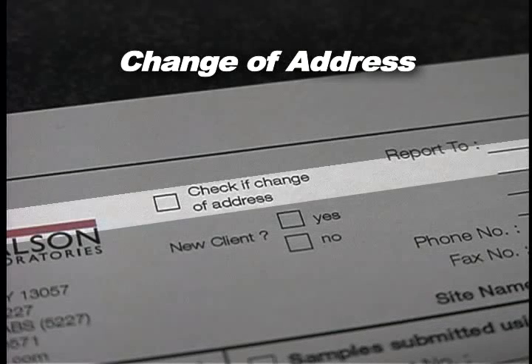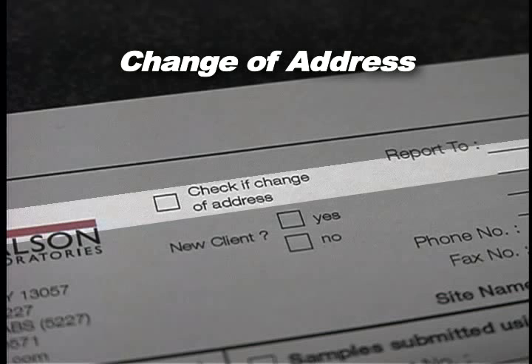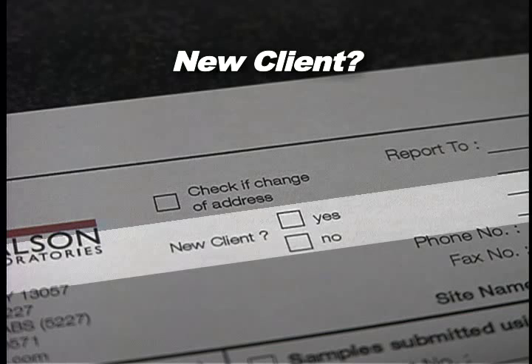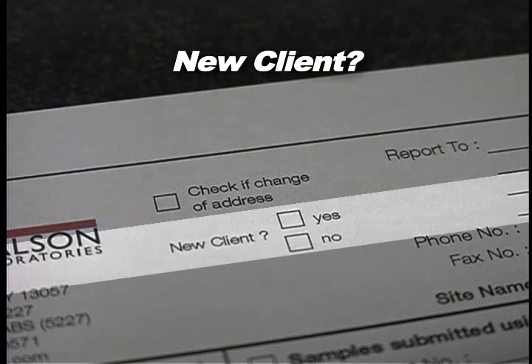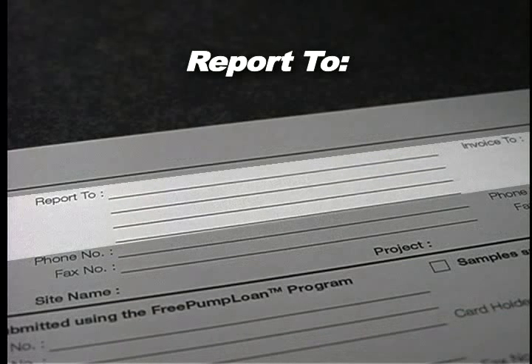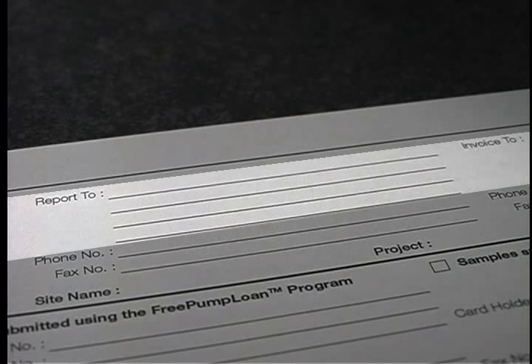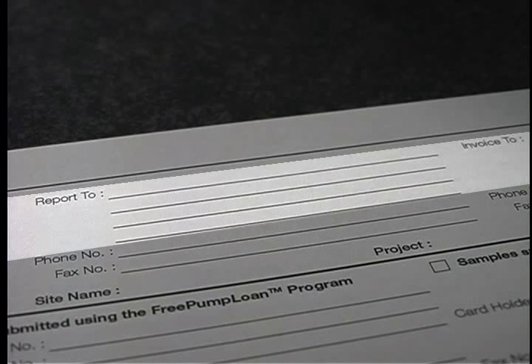Change of address: Please check this box if this chain of custody is providing us with a new address for the account. New client: Please check yes if you are a new account or if this is the first time you have submitted samples for analysis. Report To: Provide the name and title of the person to whom the final analytical report will be addressed and the complete address where the report will be mailed if a hard copy is needed.